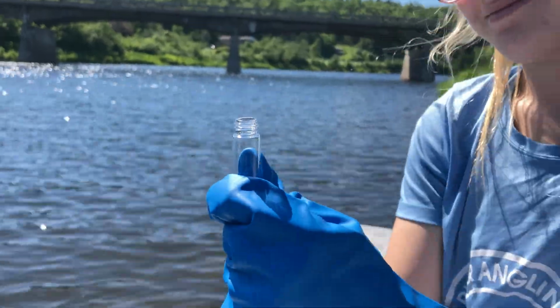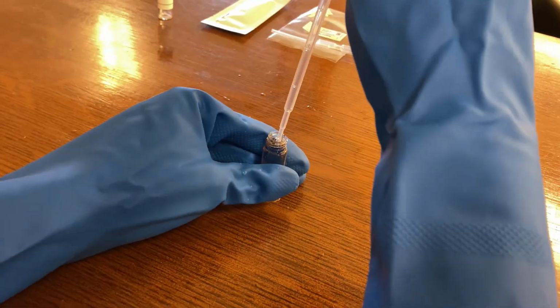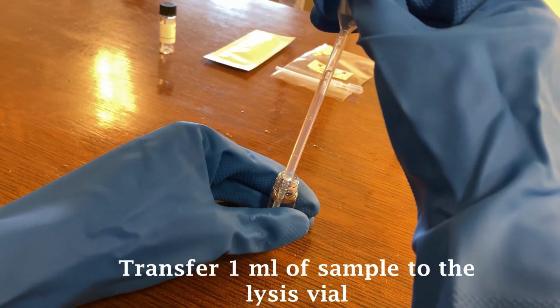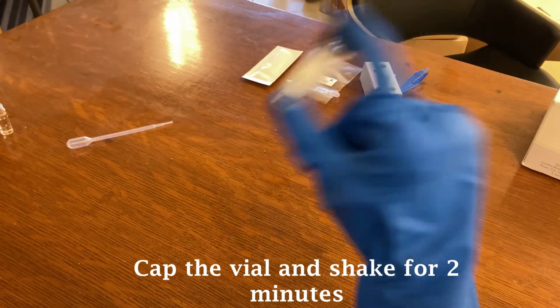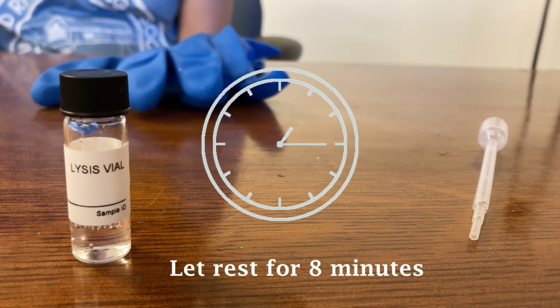First, we collected 1 to 2 milliliters of water into the sample vial. Next, using the graduated pipette provided, we transferred 1 milliliter of sample to the lysis vial containing the dried lysis reagent. We then capped the vial and shook for 2 minutes. Afterwards, we let rest for 8 minutes.